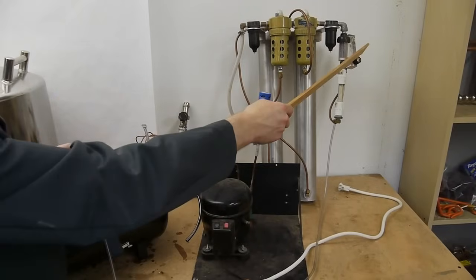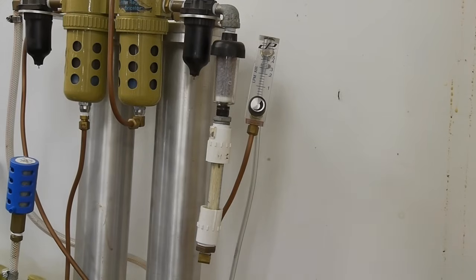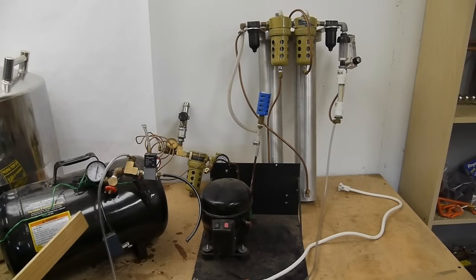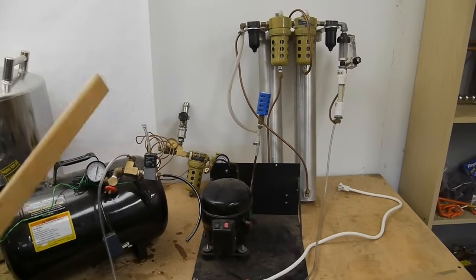And as you can see to control the flow rate I have this needle valve with a flow meter there just to check exactly how much is going through it and this was a source of constant difficulty with this system because I had to adjust the needle valve quite regularly.